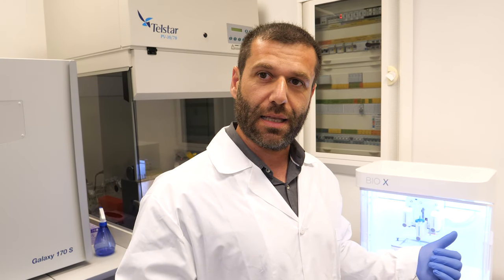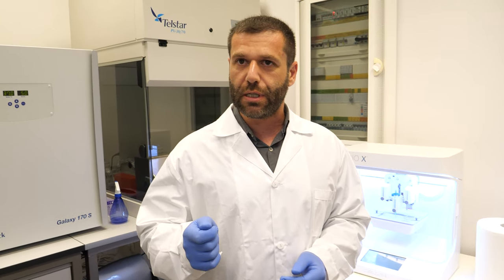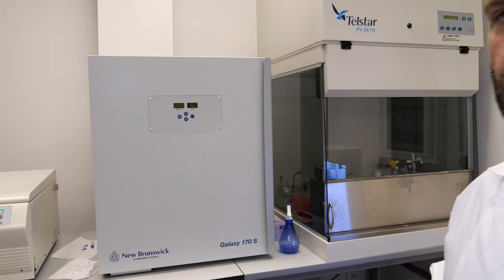In the future, potentially you could print organs. That is the ultimate goal. The ideal outcome would be to take cells from the patient — personalized medicine with no immune system problems. You cultivate the cells, take the appropriate biomaterials, mix them together, design the exact volume and shape based on 3D imaging like CT scan or MRI, add growth factors and biological cues, and then bioprint the construct.